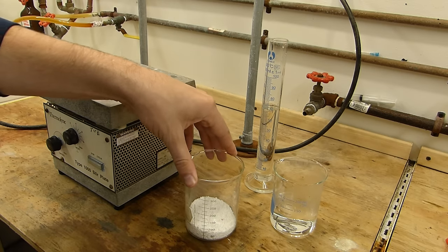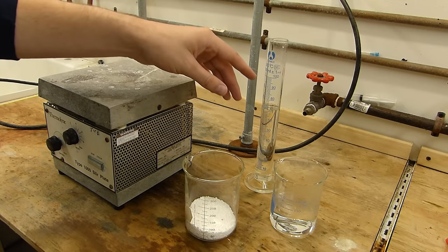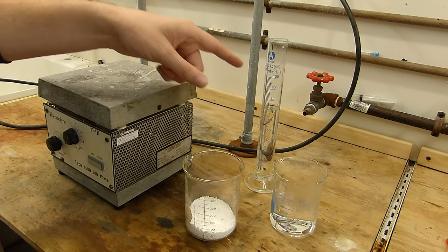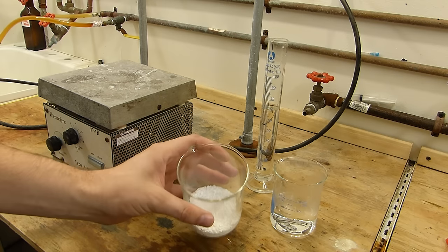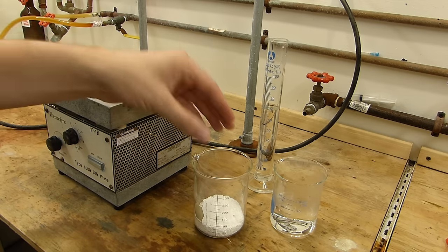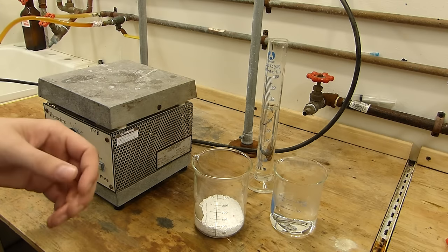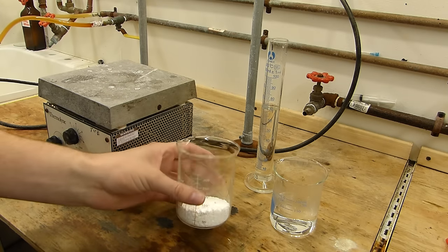So 60 grams of potassium benzoate, 100 milliliters of hot water, and then 70 milliliters of 25 percent hydrochloric acid, which corresponds to a 25 percent excess over the benzoate salt that's needed for the full conversion of course. And that extra acid is going to help force more benzoic acid out of solution.